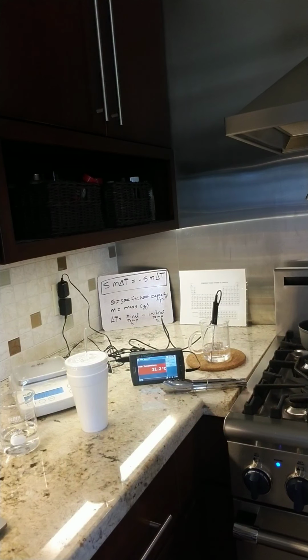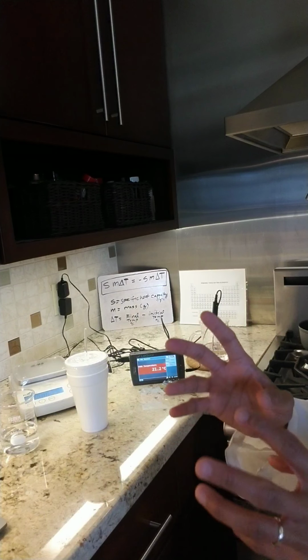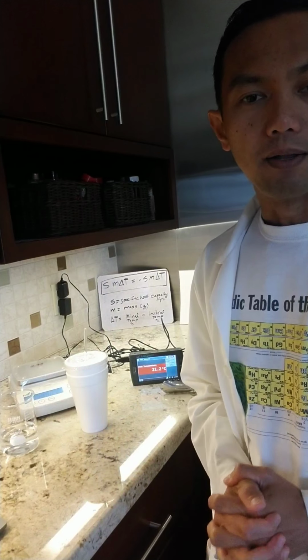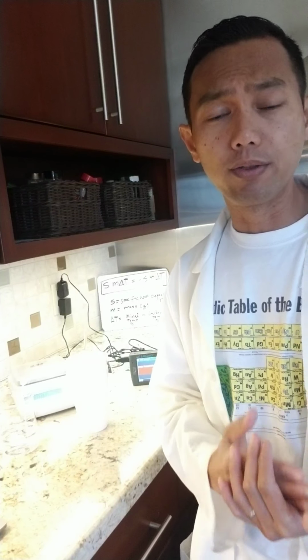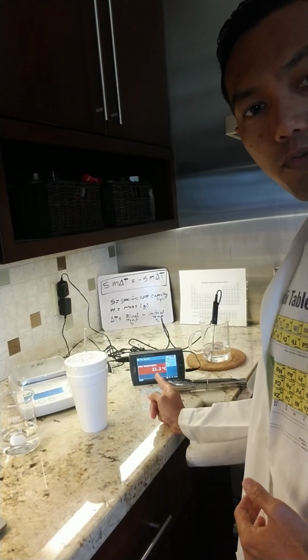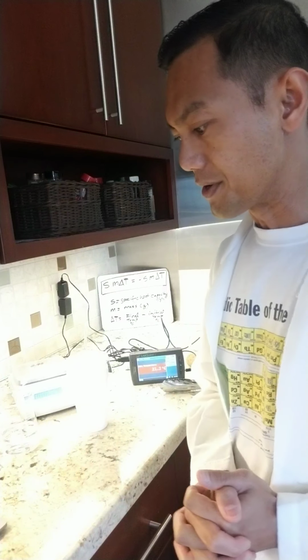But we do have two metals that are heating up, and I'm going to lower the fire because it's been boiling for a while. The idea here is that the temperature of those metals must be comparable to the water that it's been boiling in, and it's been there for a good 10 minutes or so, so our starting temperature for those two metals should be 100 degrees Celsius. So those are our initial data: 21.2 degrees Celsius for the water we're going to be using, and the initial temperature for metal A is 100 degrees Celsius.